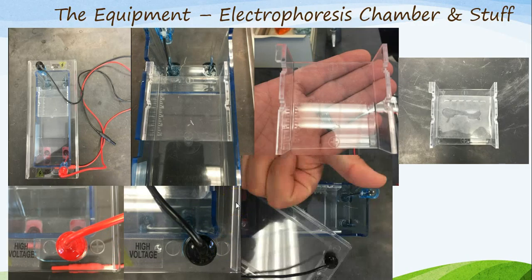Another thing I want to point out is the fact that if you look on top of the tray, they have yet another dummy-proof indicator to setting it up correctly. On the tray inside the chamber, you will notice there is a negative symbol, indicating that it needs to be on the negative end of the chamber. If you notice on the lid, there's the negative symbol, otherwise known as the black electrode. If these two things match up, thumbs up.